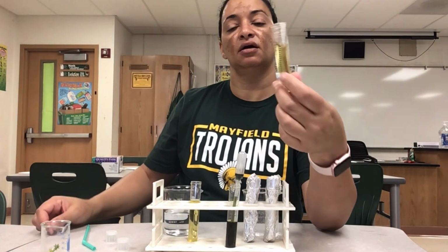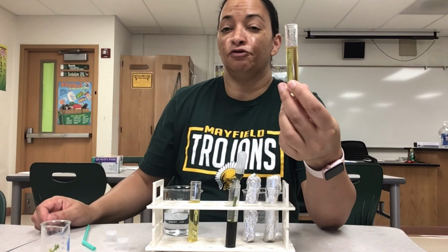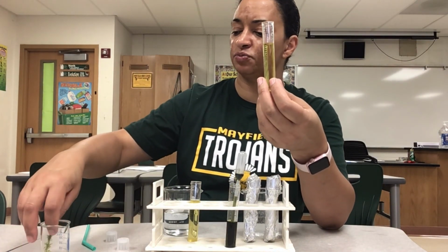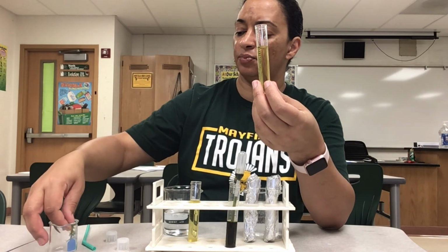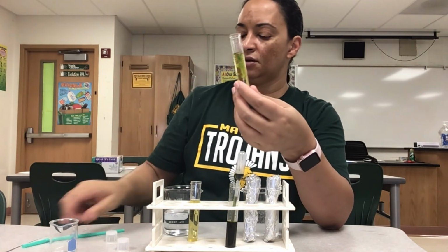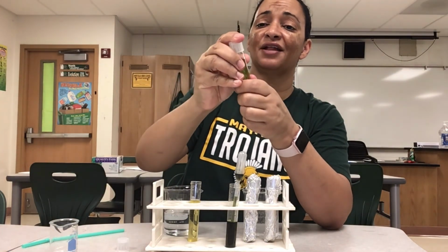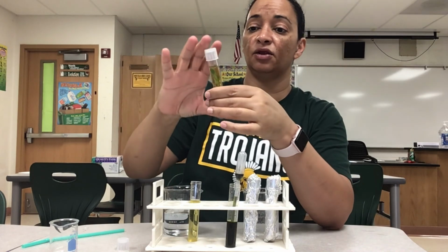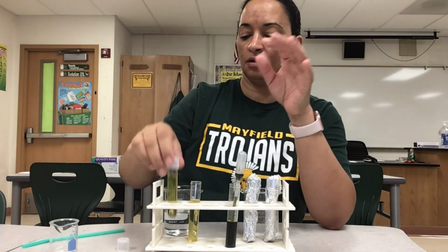Okay, over here, I have a tube that I have infused carbon dioxide into, so we have a nice yellow color. So I'm going to take my other sprig of Elodea, and I'm going to put it in there. Use my straw to push it down. Put the lid on it. This one is going to sit under the light. So I'm not going to put anything on the outside. It's just going to be Elodea hanging out in the light.